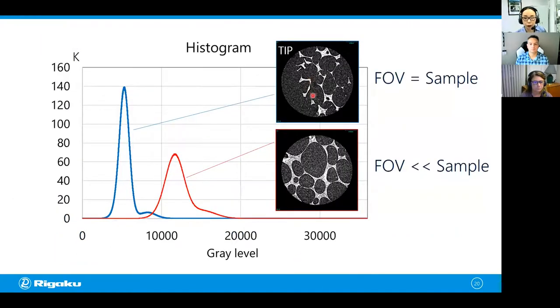So with the tip, when the sample size was more or less matching the field of view, you see a sharp peak, this is a histogram. You see a sharp peak from air and another little peak from the foam, and you have a dip in between, meaning that they have pretty good contrast and are easy to segment. When you look at this larger sample scan, the air peak is broader, and the same thing for the polymer. You don't see a clear dip or separation between the two. So this means that it might be challenging to segment this image using at least traditional thresholding.